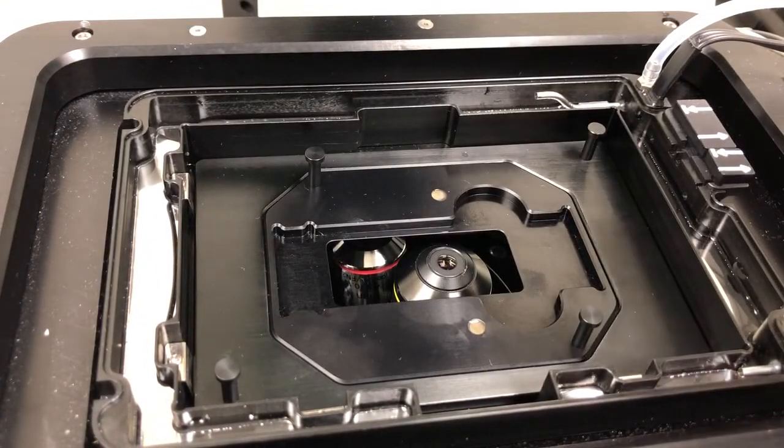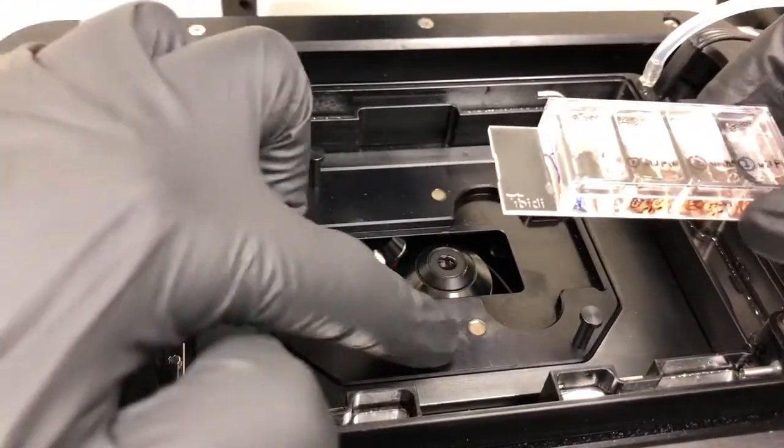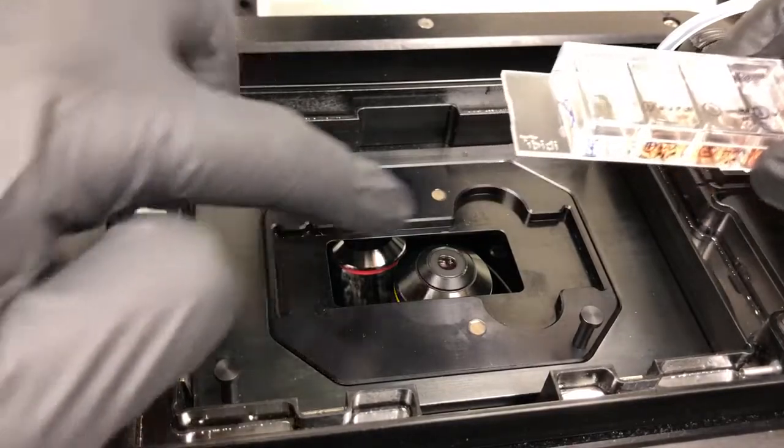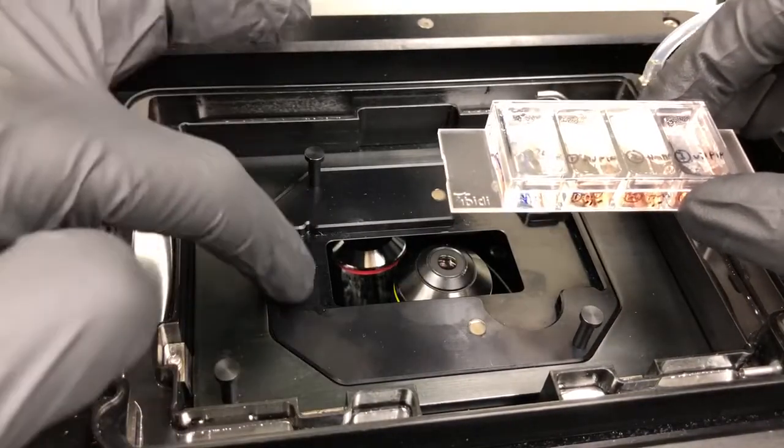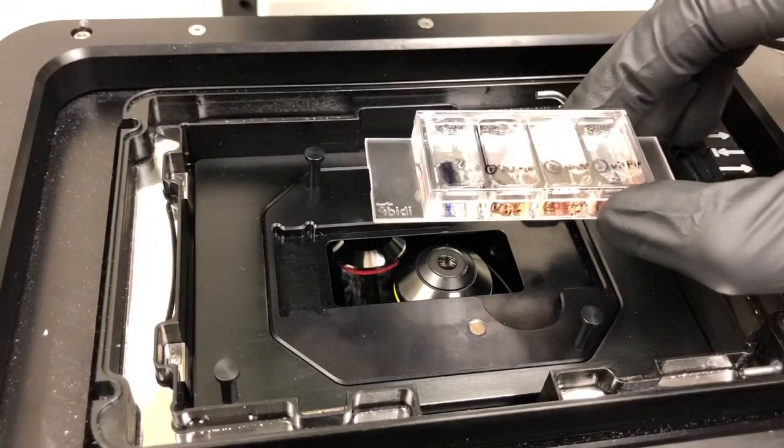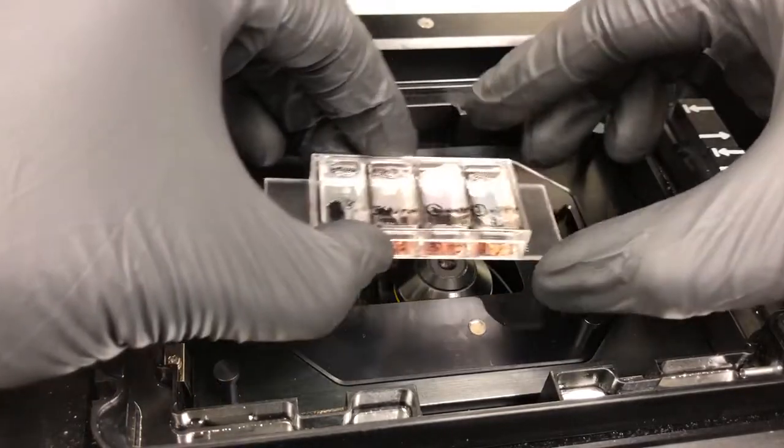Now note that we have something that has a slide shape so I'm using this insert. Also note this insert has in the corner an adapter to make this fit more snugly. Unfortunately those adapters are not the right size for this one so I'm not going to put that in.